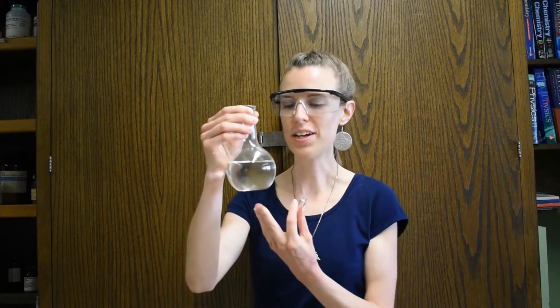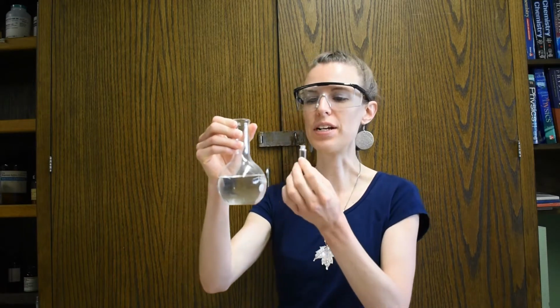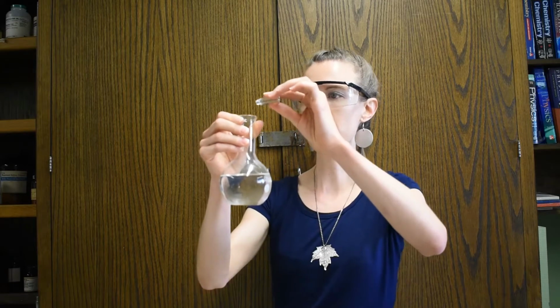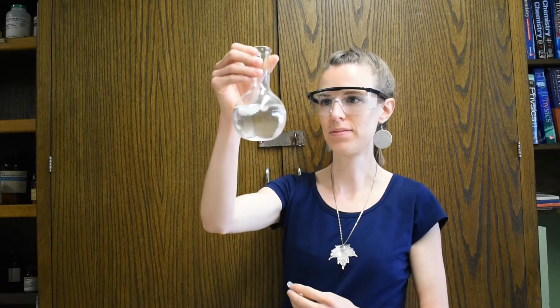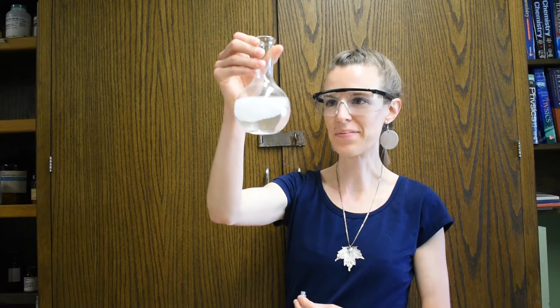I'm Miss Scarf, and I'm going to be showing you a demonstration with this mystery solution. So you'll notice that it is a clear liquid right now, and what I'm going to do is put just a tiny little bit of powder into this clear liquid. And we're going to watch what happens.